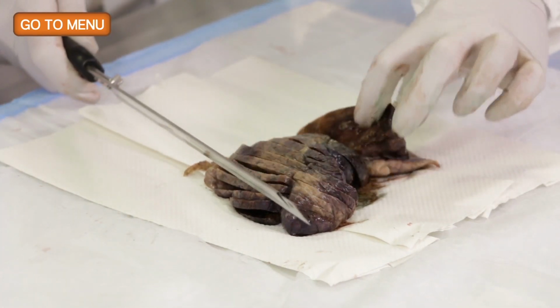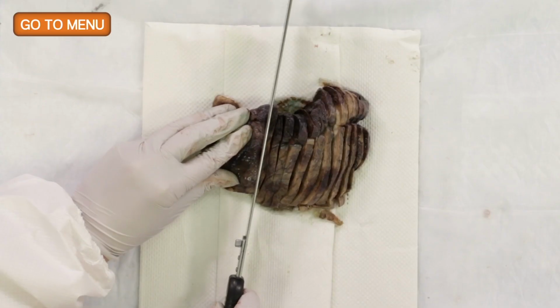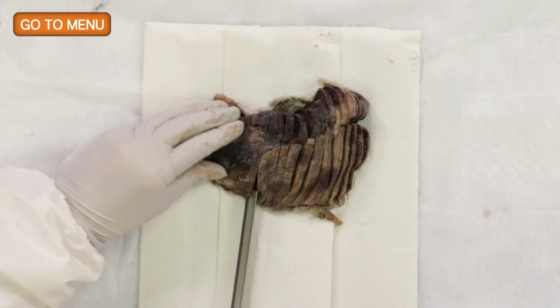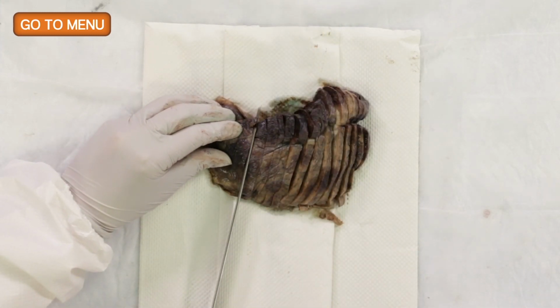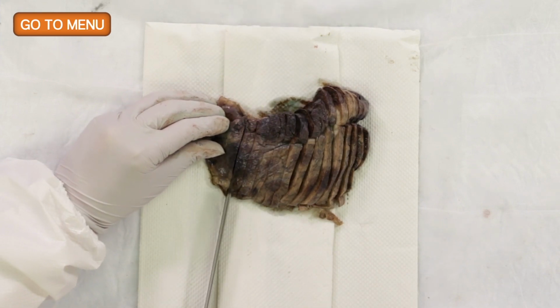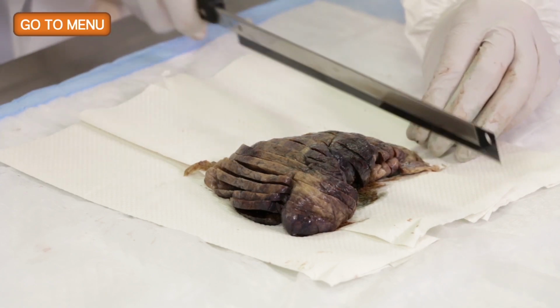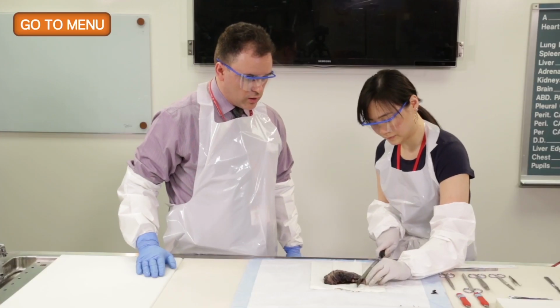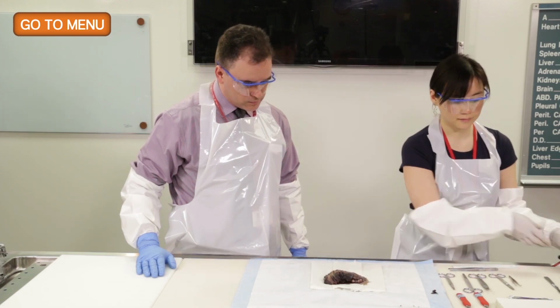Are you through the tumor mass at this point? I am. Are you going to make some serial cuts just to complete the cuts? These don't have to be as thin as the others, mainly because we're not really going to be submitting quite as much of the remainder of the specimen as we are at the area with the tumor. The purpose of cutting the rest of the specimen is to look to see if there are additional nodules and also to better palpate the specimen on the thinner slices.